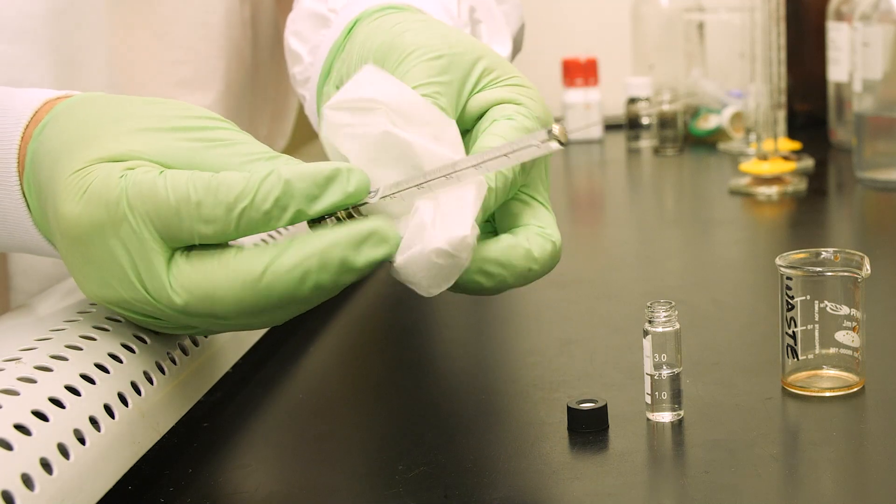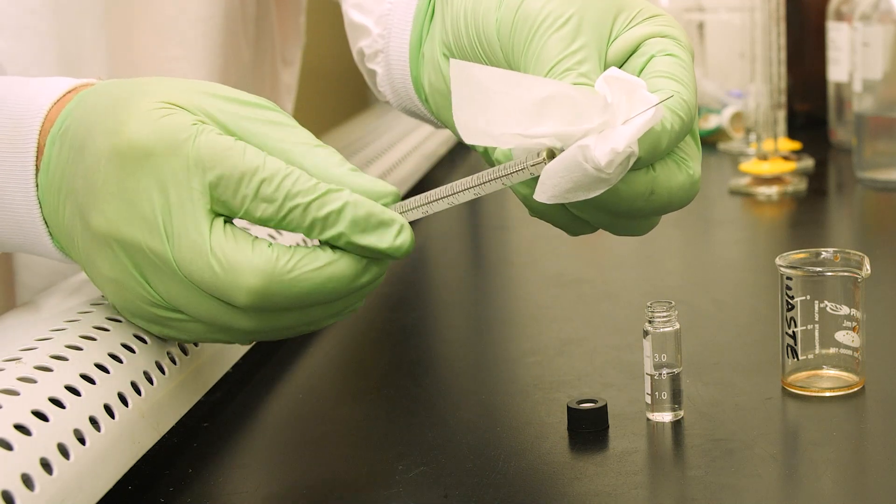If the exterior of the syringe is dirty, gently wipe it with a clean and lint-free wipe.